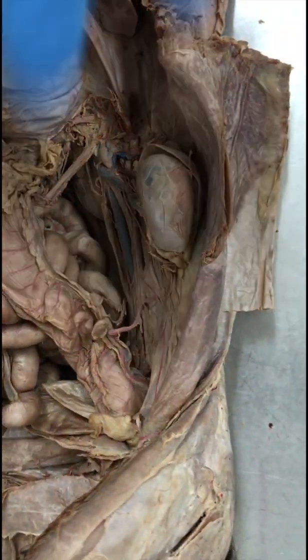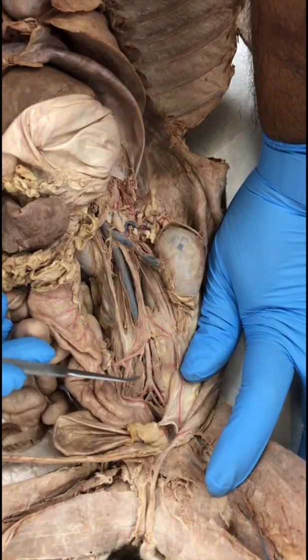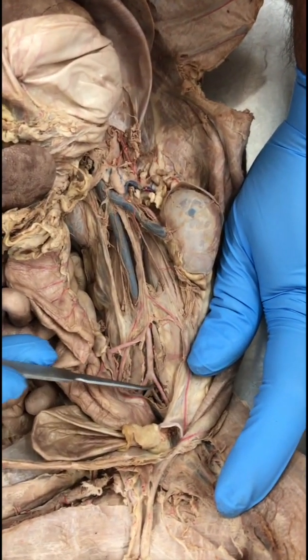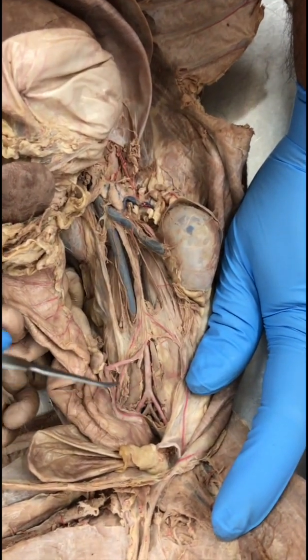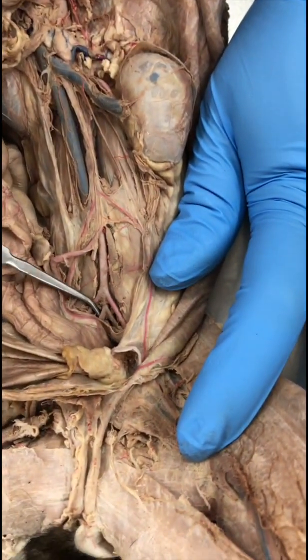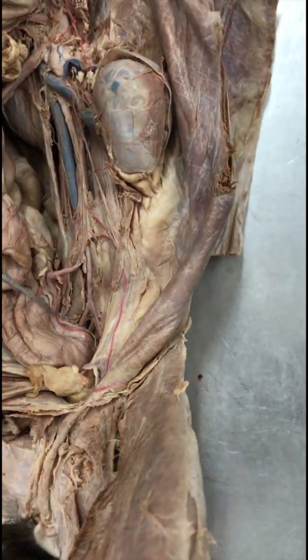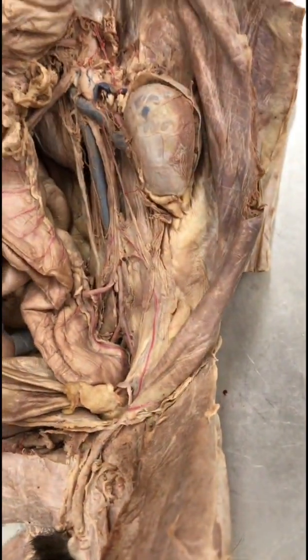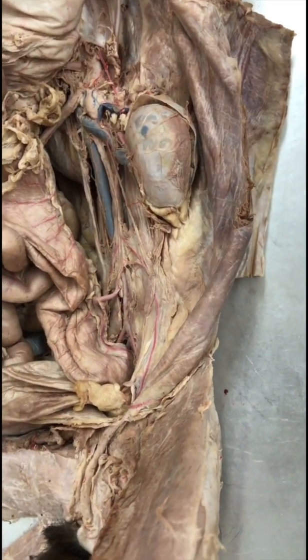External iliac artery. So that's the last branch that we are seeing here. So the dorsal aorta here branches into the external iliac artery, right and left. And the second branch that you see here are the internal iliac arteries. It's not in the list, but because it is visible here, I wanted to show you. So external and internal.